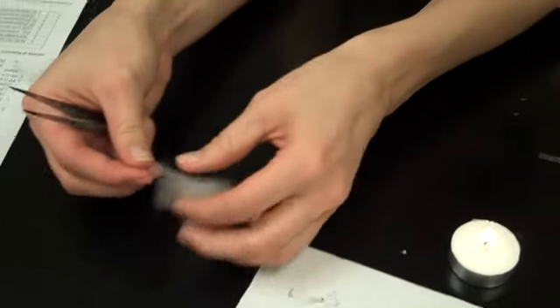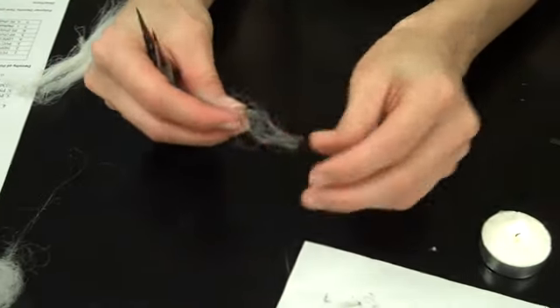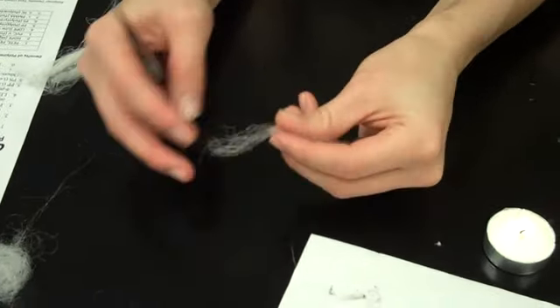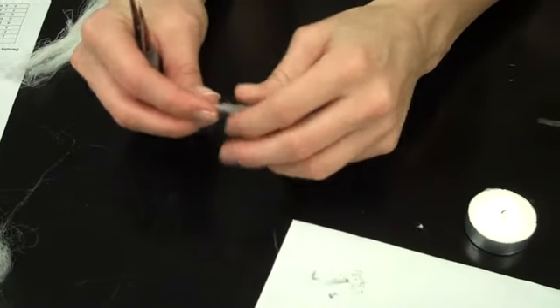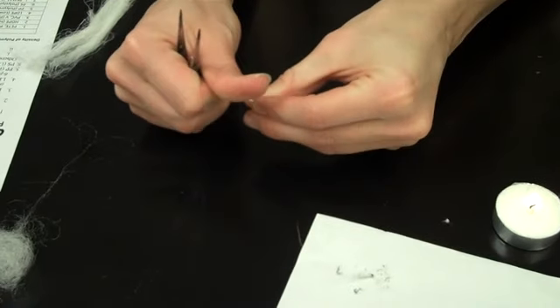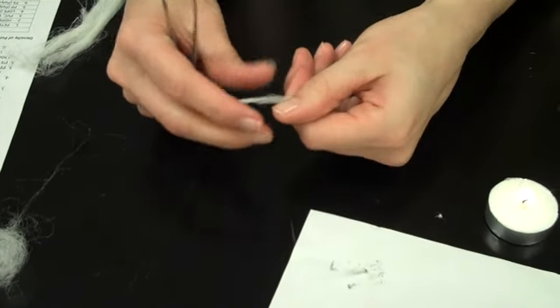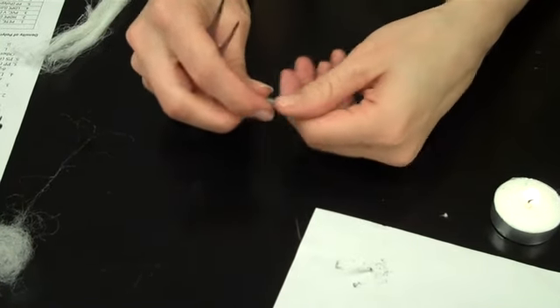Now I'm going to try another unknown fiber. I'm going to get a little bit of it. This is a lot, but I'm using large samples so it's easier to see. You don't need to use this much when you do it yourself. Go ahead and twist it up to get it nice and compact.